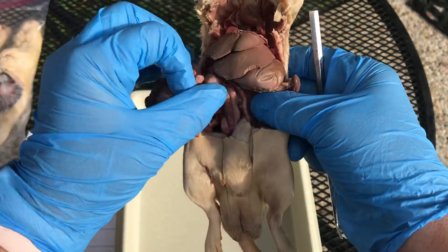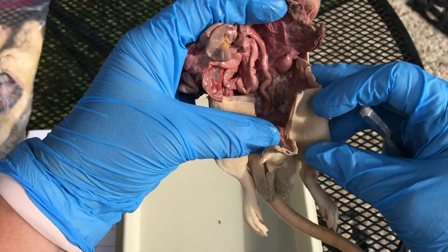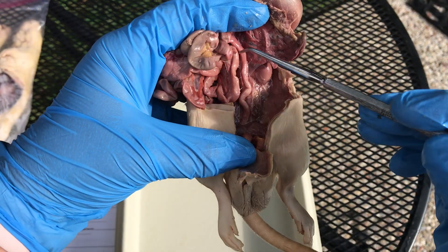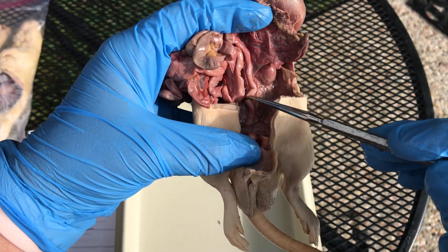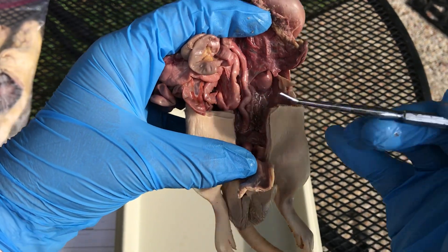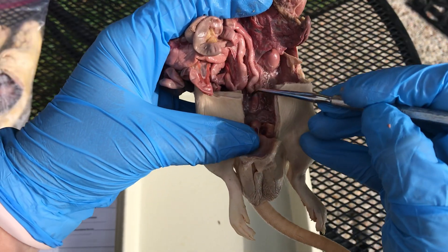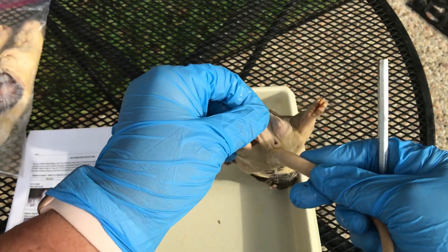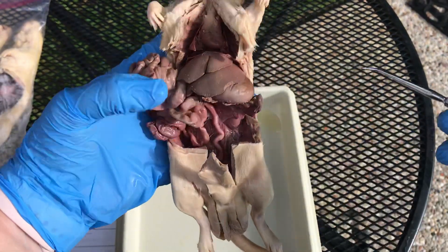Continuing with the large intestine, this last section right here is called the rectum. Normally you would see a wad of feces there; some rats will have a visible fecal matter ball at the rectum. The rectum leads out to the anus — on this male, the anus is back here by the tail. A female would have the anus in the same place but has more openings than the male.